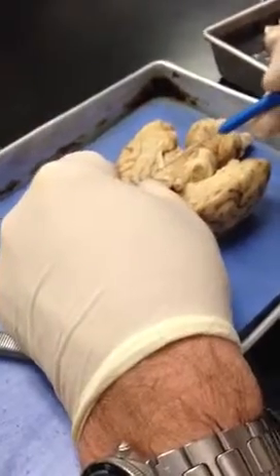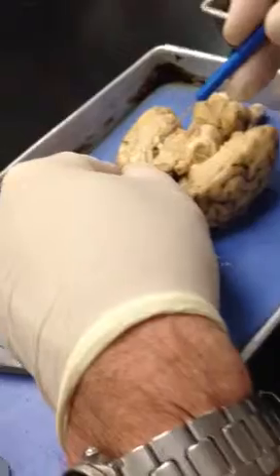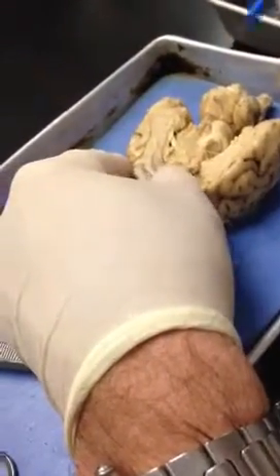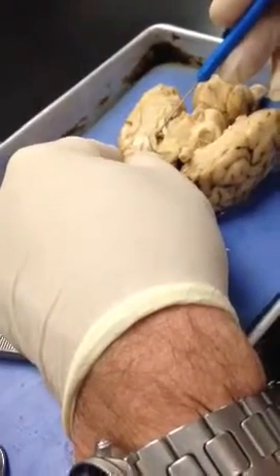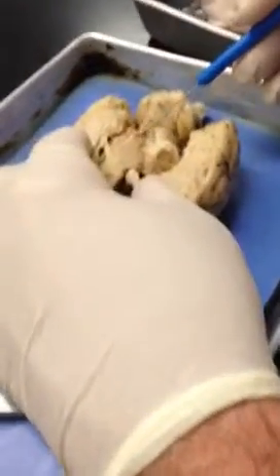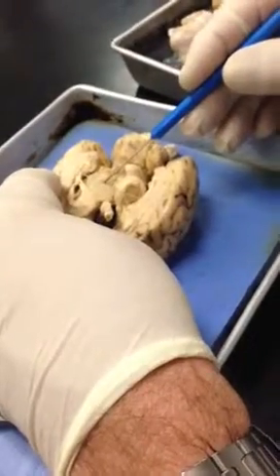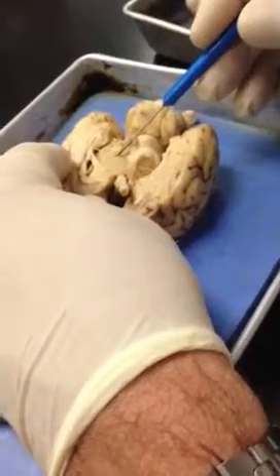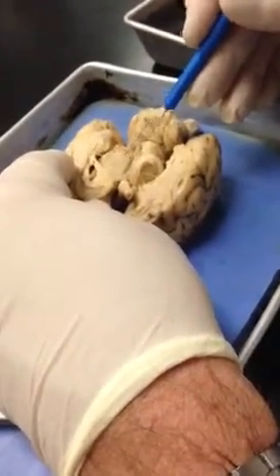So let's poke through it. If we poke through this thing and break it, you can see there's a space back in here. That's one of the lateral ventricles. The septum pellucidum kind of seals over it. So right back in there is one of the lateral ventricles. This sort of round area that I'm outlining with my probe, right there, that's the thalamus, and that would be the center of the thalamus. The hypothalamus is just this area sort of in front of it. It's not a distinct area.